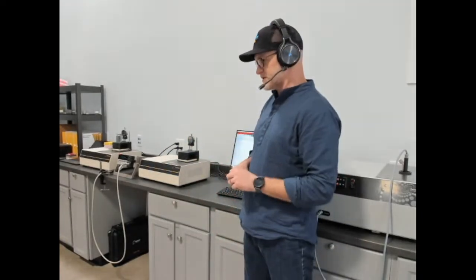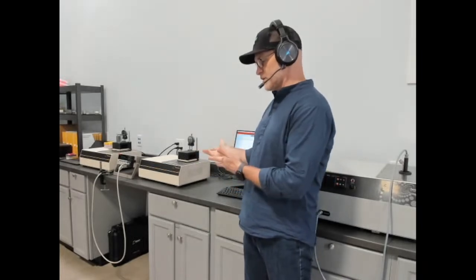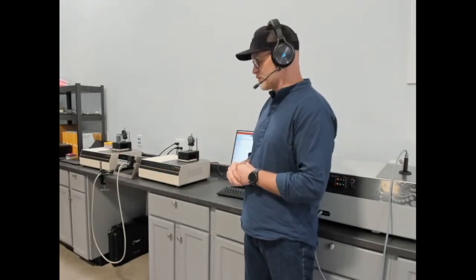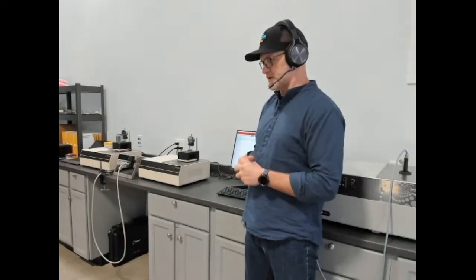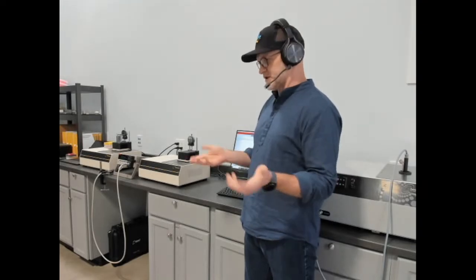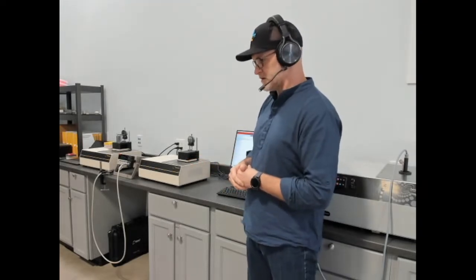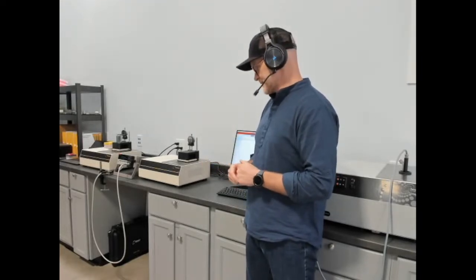from a few millimeters to 25 millimeters thick. We designed that to be an affordable heat flow meter for narrow applications, but more importantly, when you're measuring heterogeneous insulation, as I just described when I was discussing the GHFM, which many are, you're using the proper method, one that's measuring resistance-based thermal conductivity.